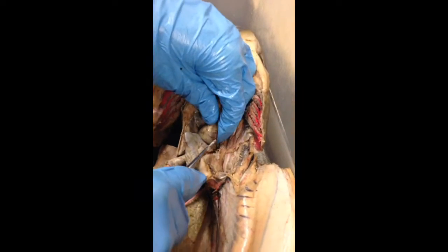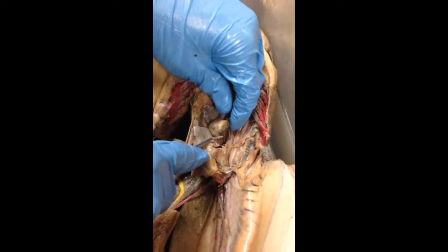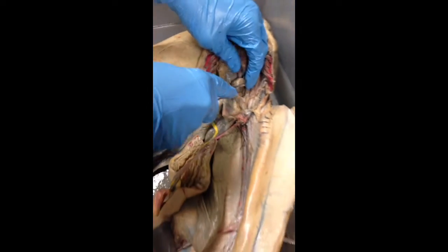Next is the ventricle, and the ventricle of the heart is pretty easy to differentiate. It's the bottom part of the heart — the larger, bottom cavity.